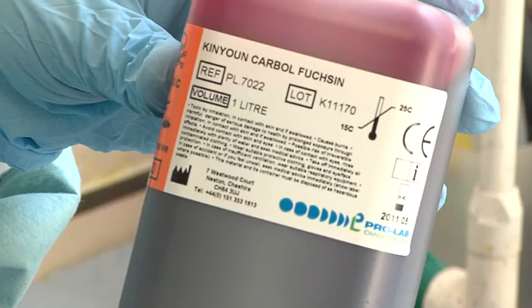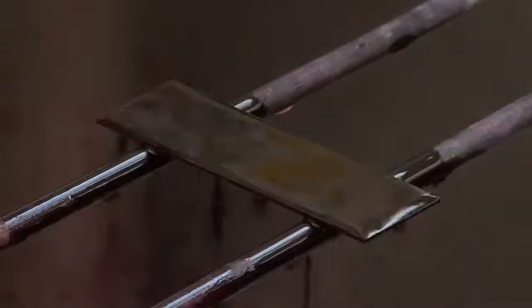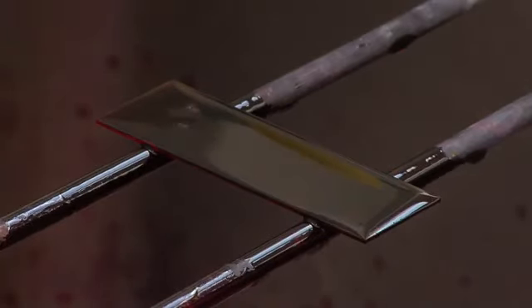An acid alcohol fast bacilli positive smear is a very significant result for clinical patient management. Positive patients require prompt anti-tuberculous treatment, infection control isolation if they are inpatients, and tracing and treatment of contacts needs immediate follow-up.